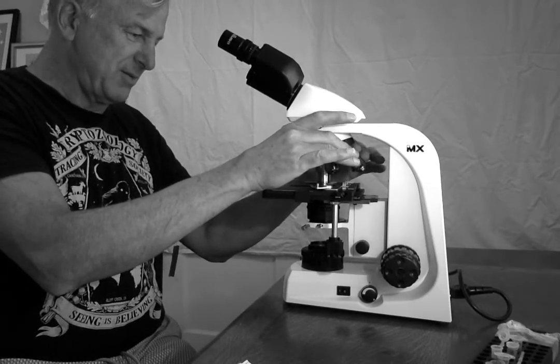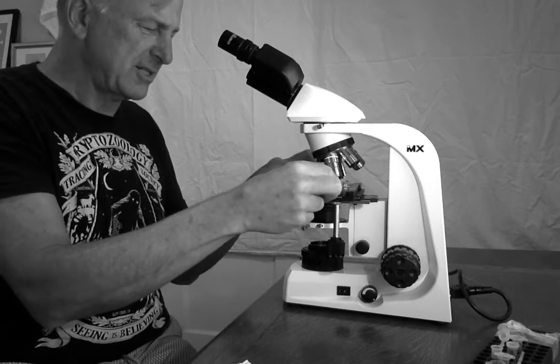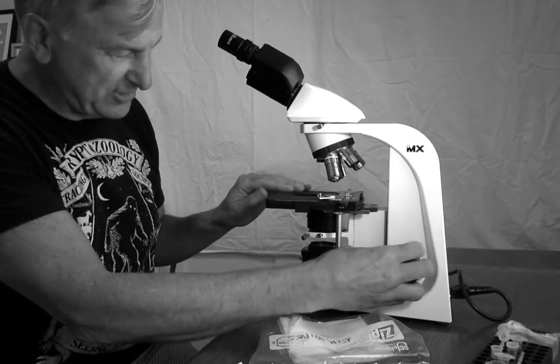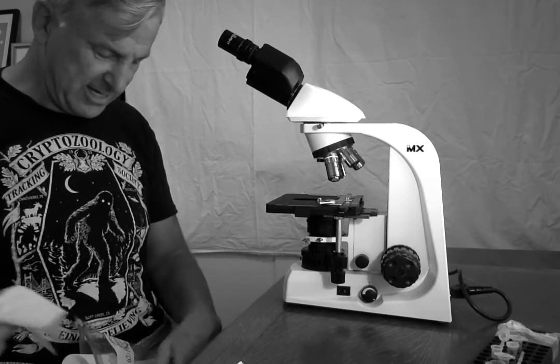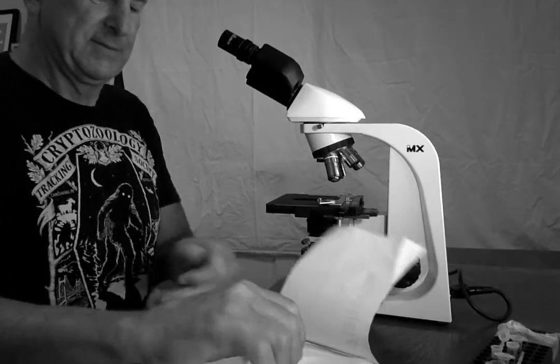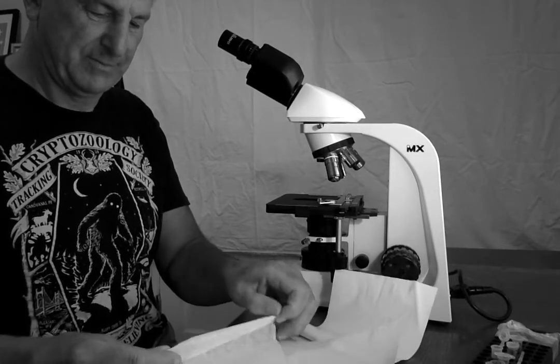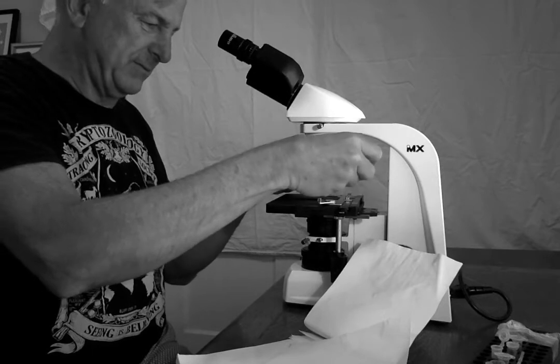In this quick demo, I'm going to move this back away so that it's split between the 40x and the 100x. I'm going to move this oily slide off, and I'm going to clean the oil. I'm going to lower the stage so I can get to this oily lens. I am going to take, no, not a Kim wipe. I am going to take lens paper. I'm going to fold it into a multi-folded strip. And I'm going to wipe the oil off gently.